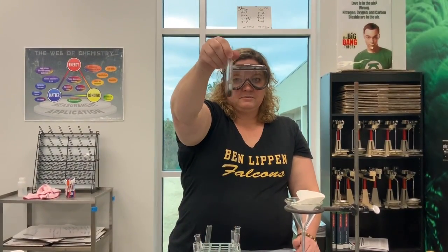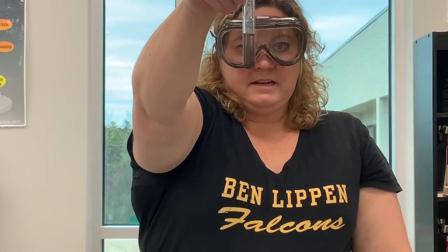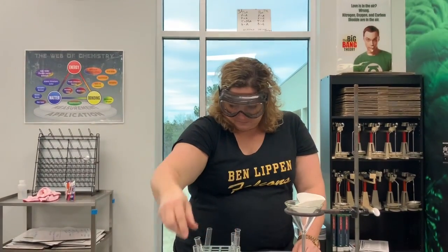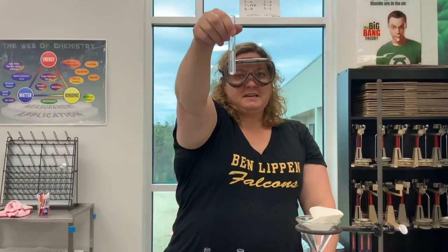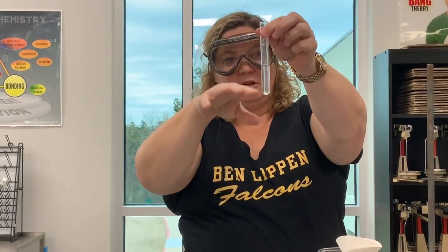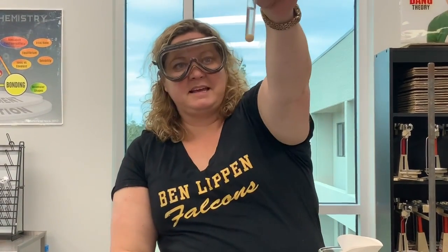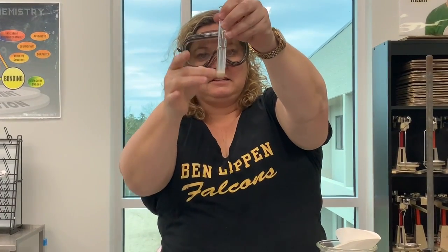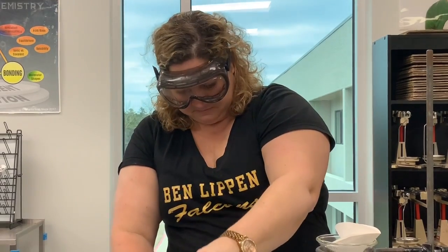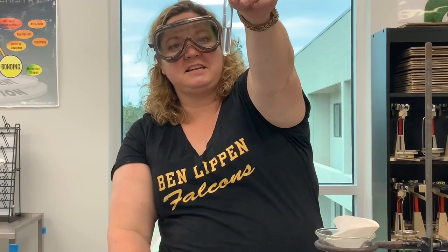The iron, and you'll watch it settle right back down, also not dissolving. Sodium chloride, this has dissolved. So it was up to here in white table salt, and you can see now it has dissolved. Sand did not dissolve. And this is our sucrose, and it did dissolve.